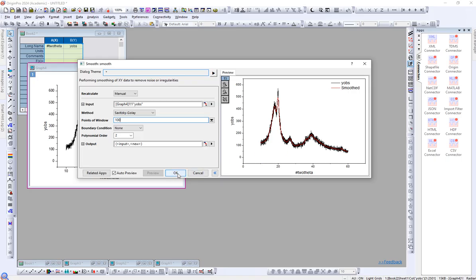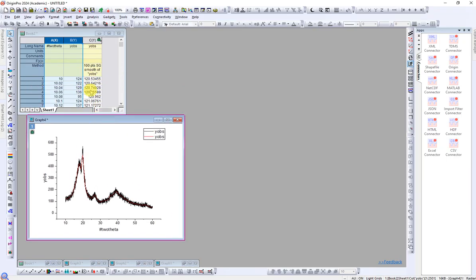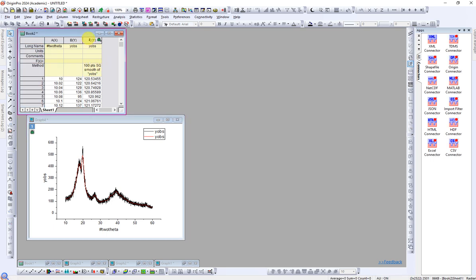Let's click OK. Yeah, so if you look here, you will get y-axis data for the smooth graph, which uses 100 points in the window. So if you put 200, then it will be 200 here. So let's draw this graph. So you choose the y-axis, and you can choose a similar x-axis, and let's draw a graph.